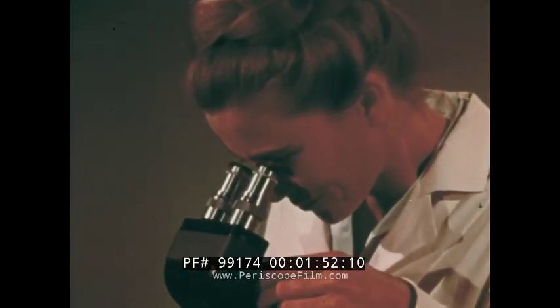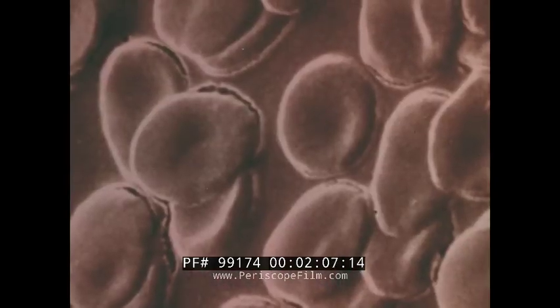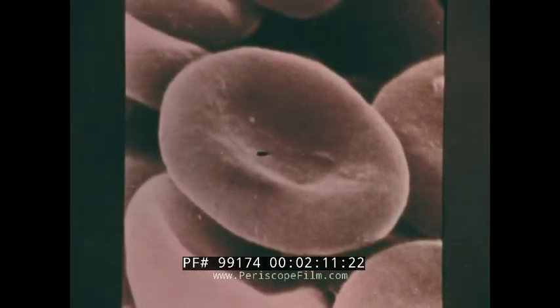Anna can easily distinguish the red blood cells by size and shape. But the image is only in 2 dimensions, as flat as a drawing on a sheet of paper. This same blood smear, in the scanning electron microscope, produces these unique images of red blood cells.